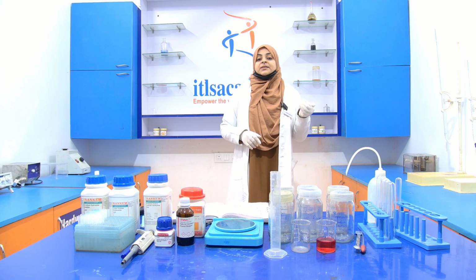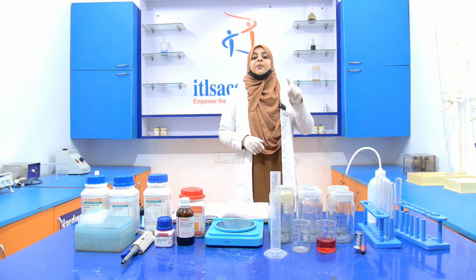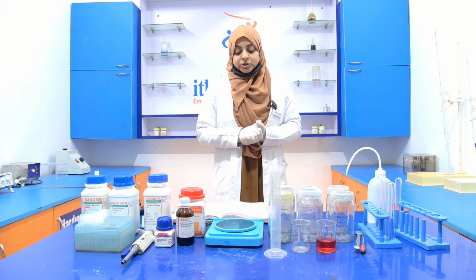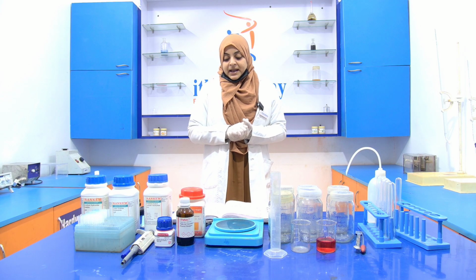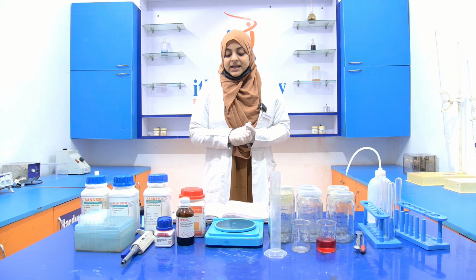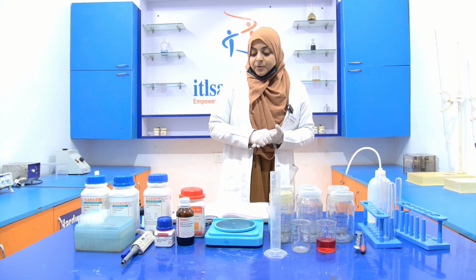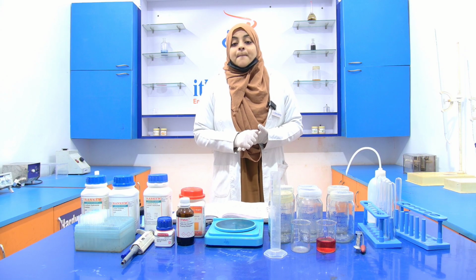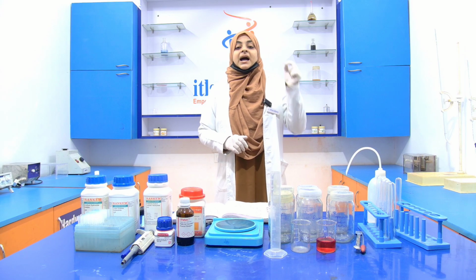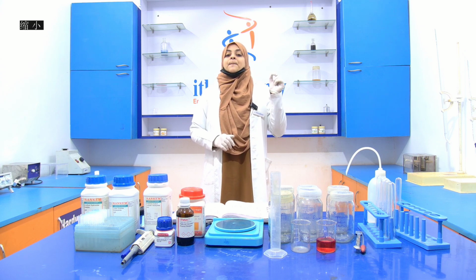So the estimation of the protein by Lowry's method is also based upon a principle, that is, blue color developed by the reduction of the phosphomolybdic and phosphotungstic components in Folin reagent by the amino acids tyrosine and tryptophan in the protein, and color developed by the biuret reaction of the protein with the alkaline cupric tartrate, which are measured in Lowry's method.